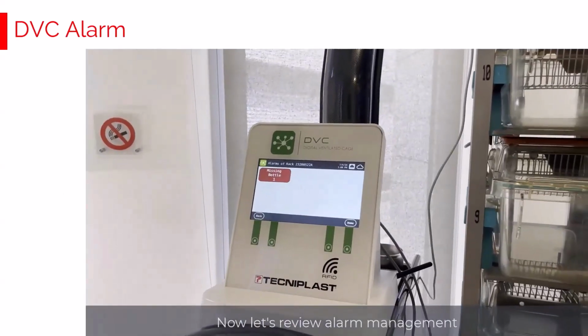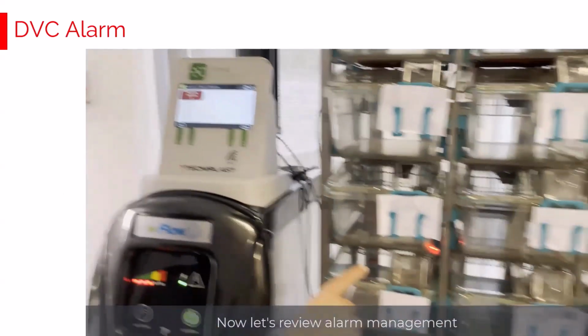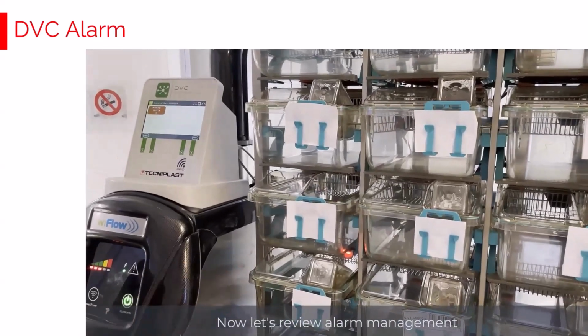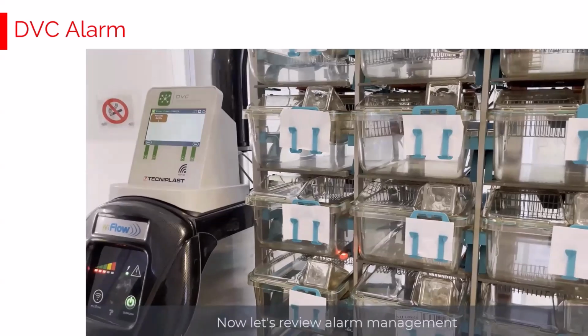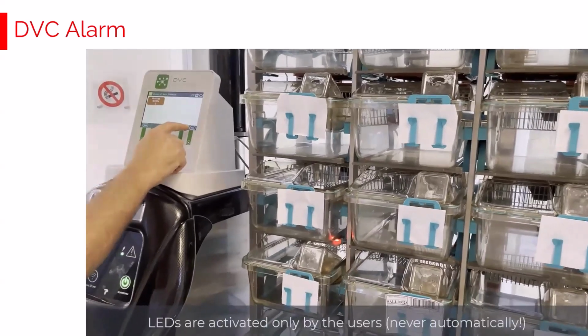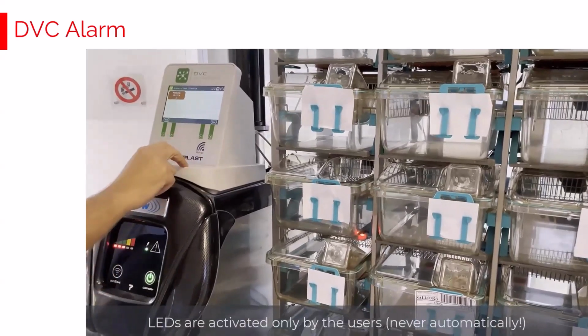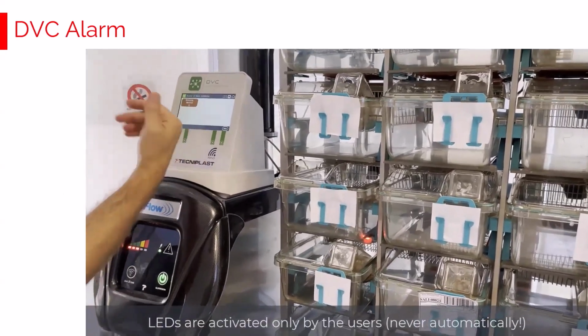Clicking, there is a missing bottle. Clicking on the alarm, the corresponding cage with a missing bottle alarm is illuminated by red light, and by inserting the water bottle, the alarm can be, in this case, easily fixed.